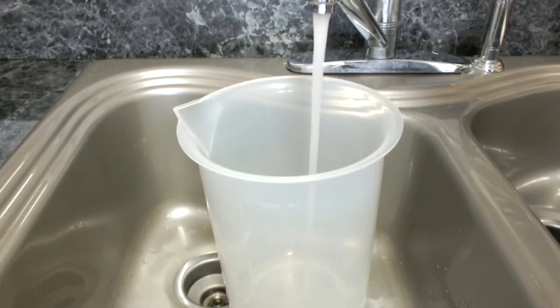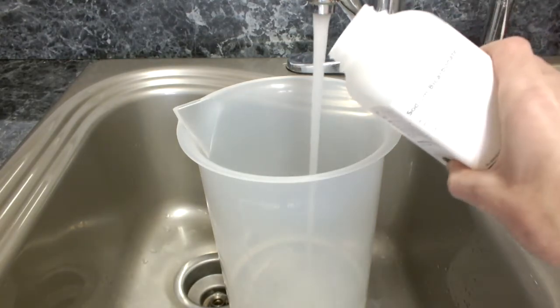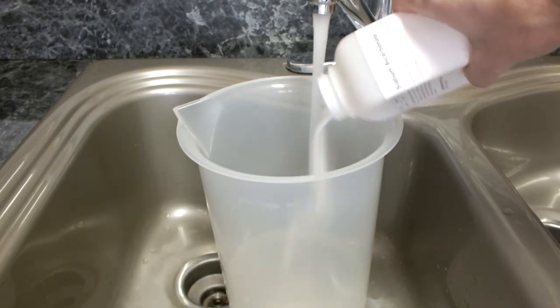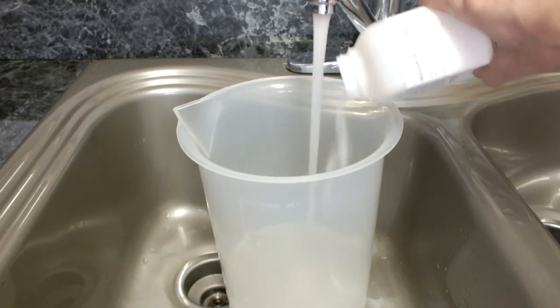Before we wrap this up, remember that both of these reactions use a dilute, but still rather strong solution of sulfuric acid. Before we dump them down the drain, we need to neutralize the acid. I use this 5-liter beaker, but any good-sized bucket will work. I fill it up to about 3 liters with tap water and add a generous helping of the key ingredient, sodium bicarbonate. It will settle, so stir it up. A little more.